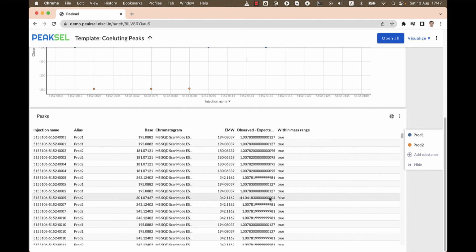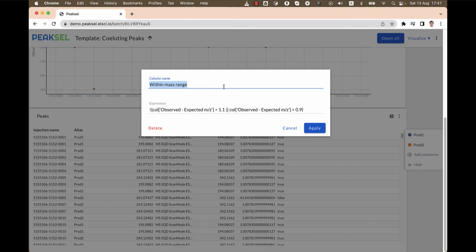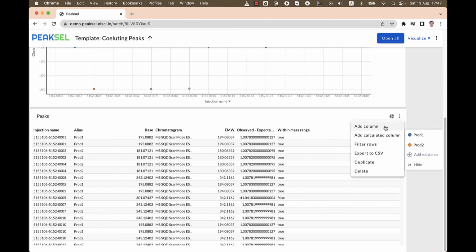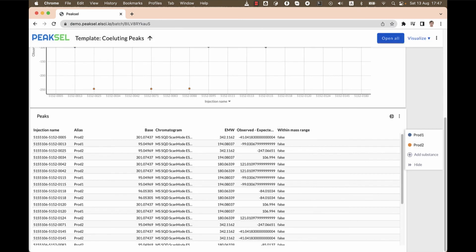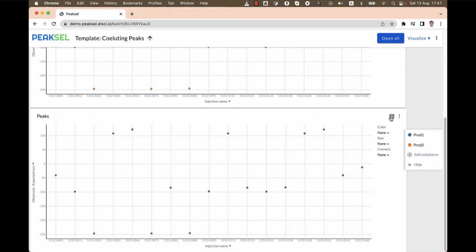What's left is to use this column in the filtering expression. Again, we'll copy the column name and we'll include it in this expression. So both conditions will have to be met. The chromatogram contains words MSSQD and the column is not within the range. The rest of the values are going to be filtered out. And now we're left with a very clean picture that only points to the chromatograms that contain peaks that are co-eluted according to our algorithm.